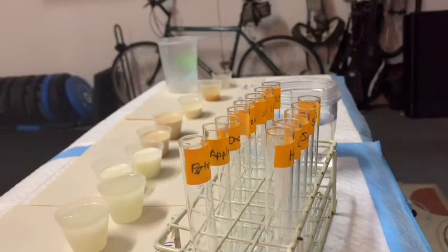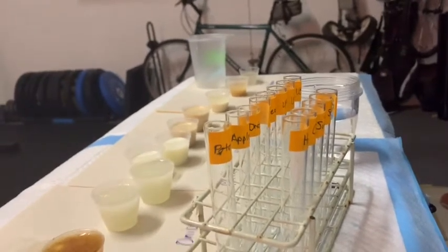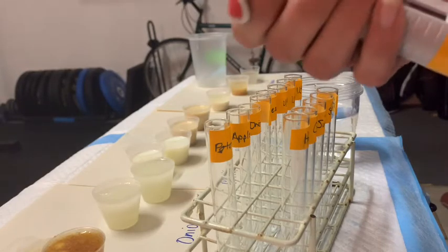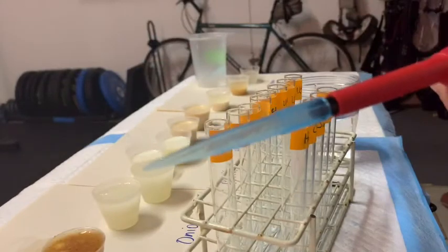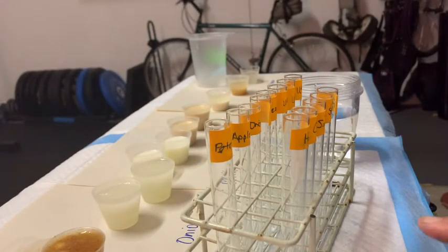We're going to begin this laboratory with the Biuret assay for protein. The first thing we're going to do is take our test tubes, which we've labeled up here, and add one mil of water to each of these test tubes. For that, I'm just going to use our P1000 pipette dialed to 1000, brand new pipette tip, and we're simply going to pipette in one mil.